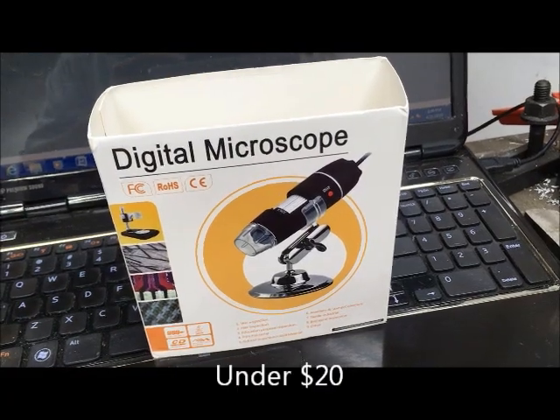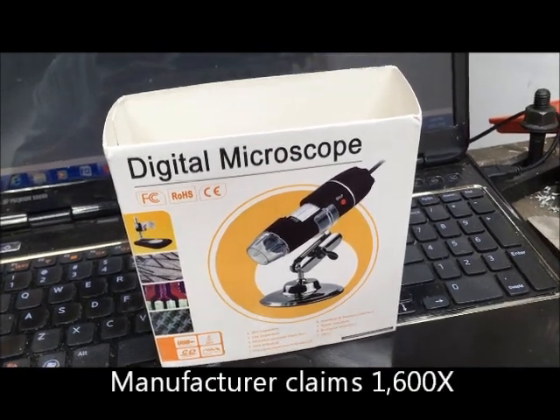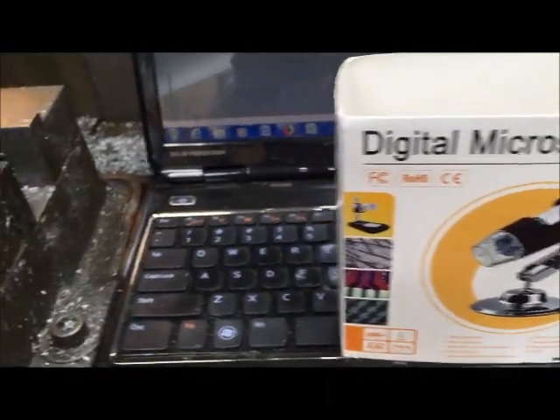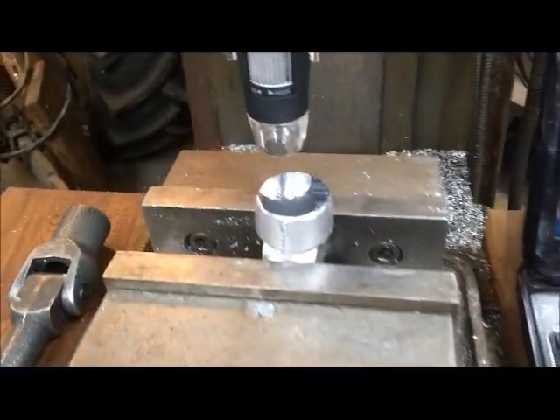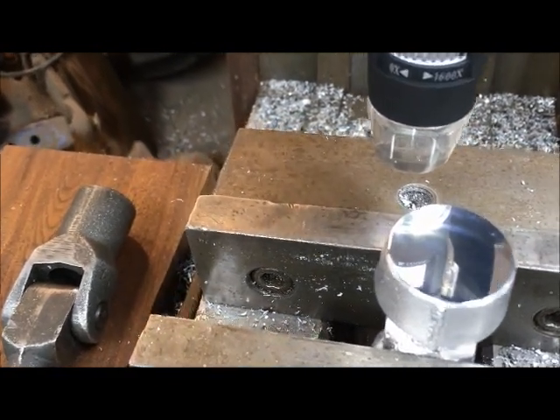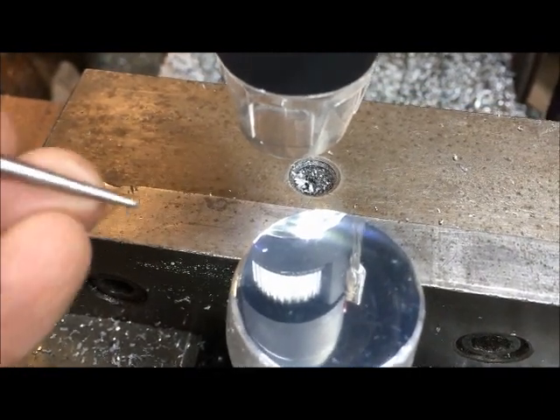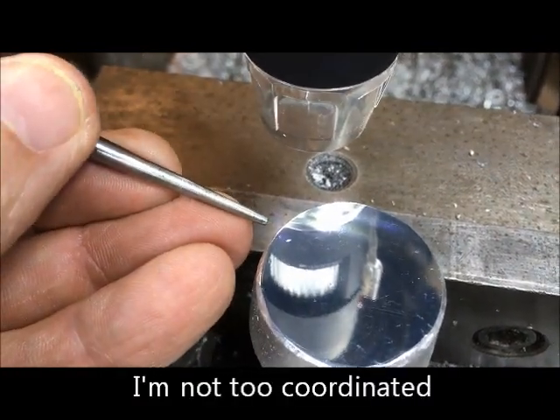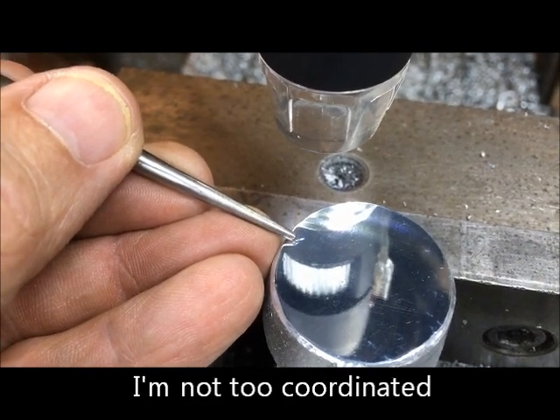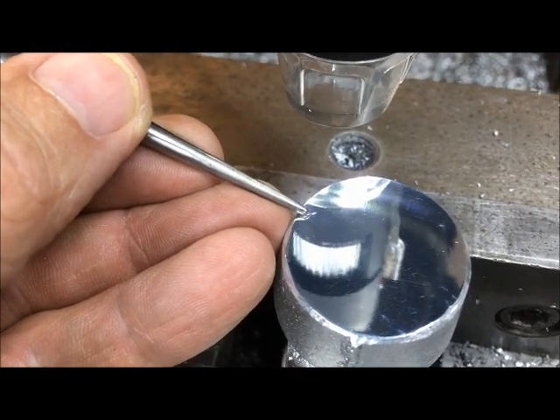My name's Andy Martin. I'm going to describe how I'm using this inexpensive digital microscope to inspect aluminum castings for defects. This is a hammerhead that's been polished, and there's a defect in it. There you can see it pretty good. Right there, that's a pretty big defect, so it'll be easy to see on the microscope.